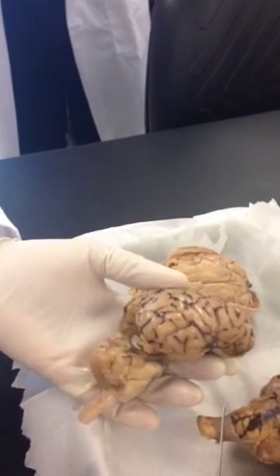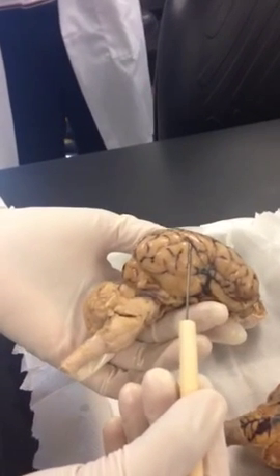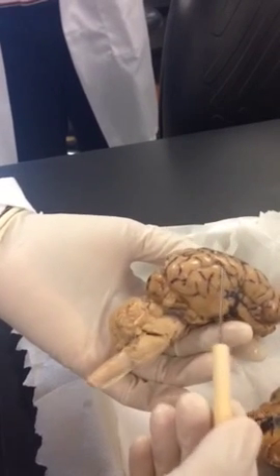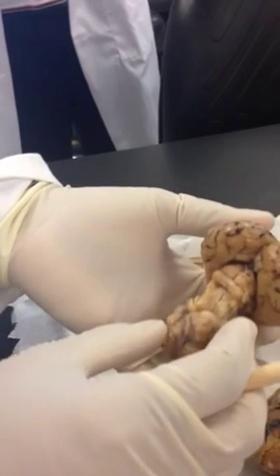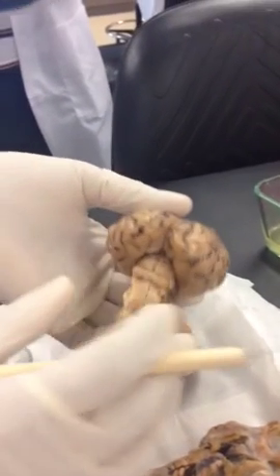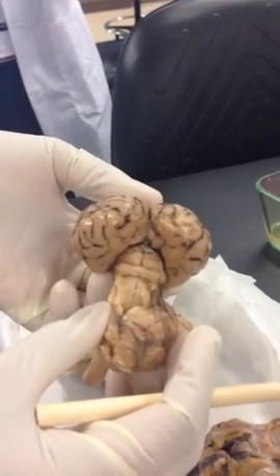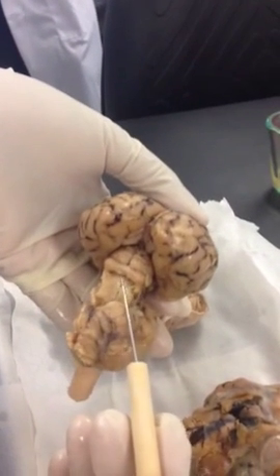There's one more lobe, they call it insula. You cannot see it, it's deeper to the temporal lobe, I-N-S-U-L-A, insula. Okay. Then if you see the next figure, the very first figure in your lab book, okay, if you pull the cerebrum and the cerebellum apart, you see, it looks like somebody sitting on a toilet seat.